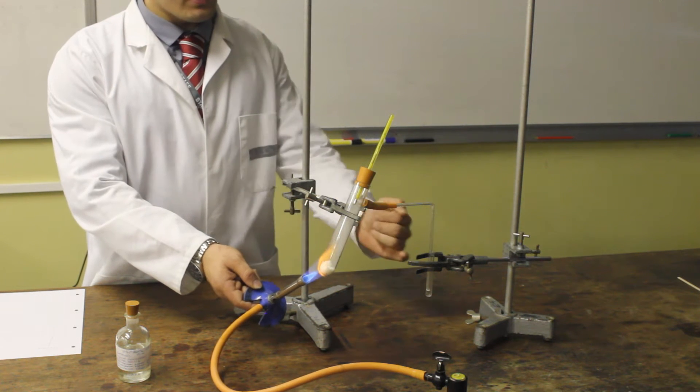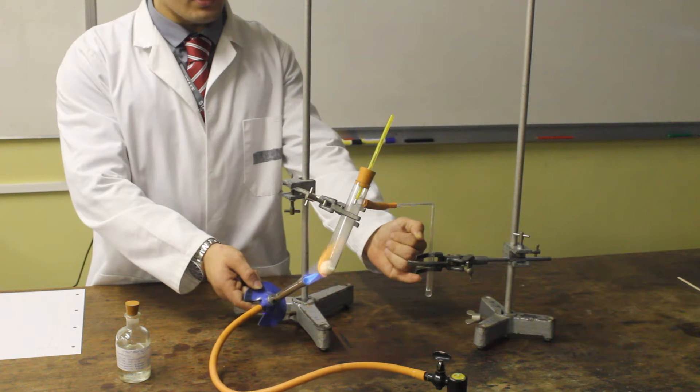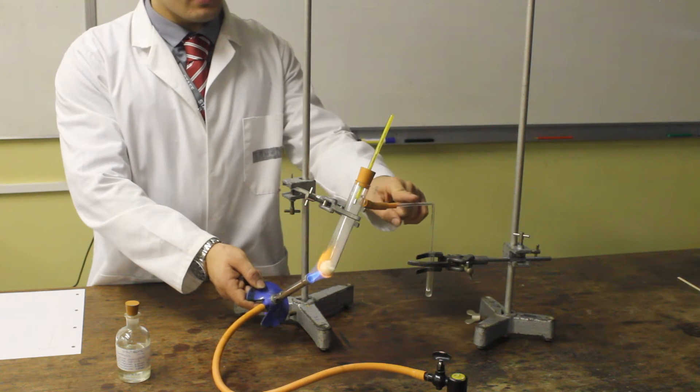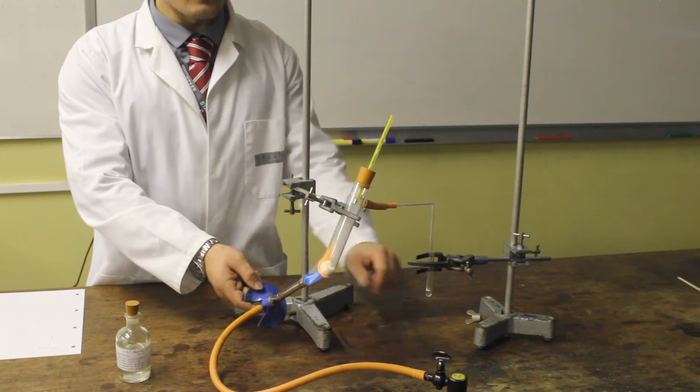If you look carefully into this tube, you will see that our first fraction has started to collect. It has been evaporated in the tube, condensing in the delivery tube, and then finally been collected.